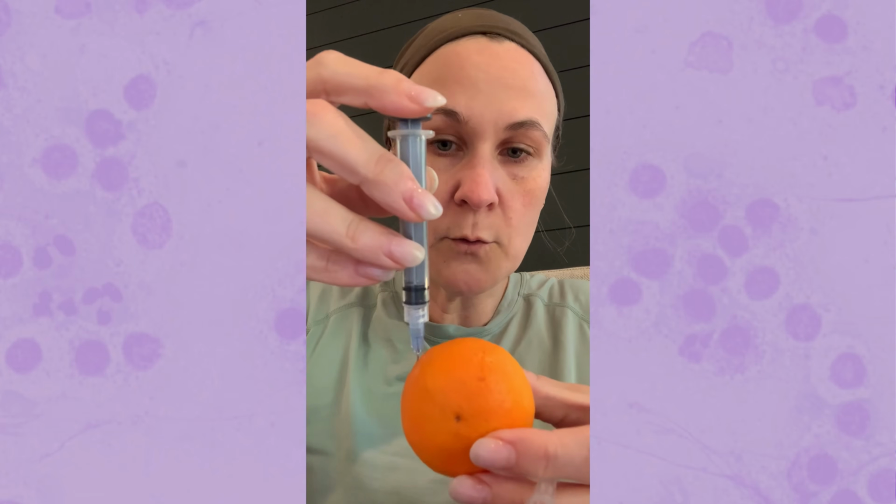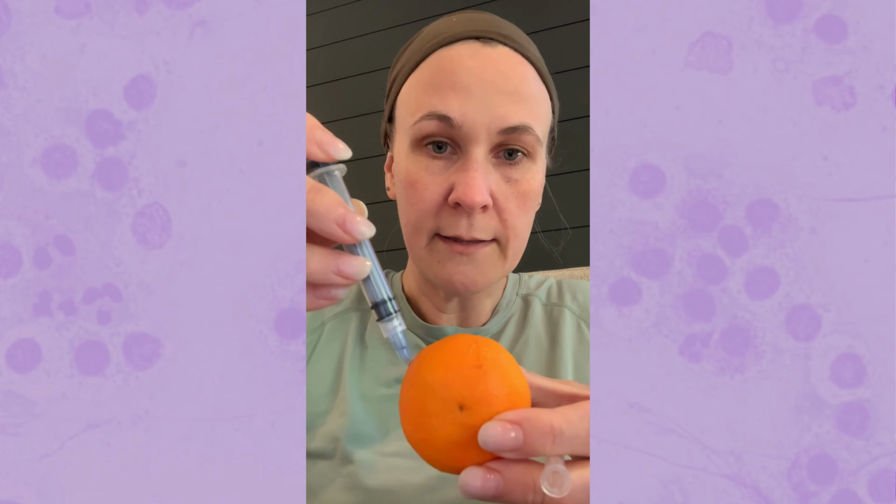So you can see here, I'm directing the needle more towards the periphery and jabbing it in like that, as opposed to like this. Now, if the mass is really small, you just do what you can do. But that's one tip to help in those types of cases.